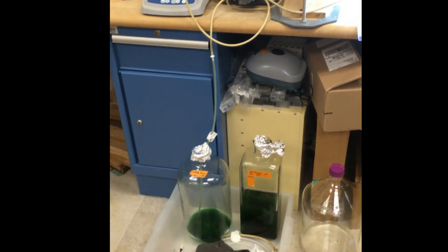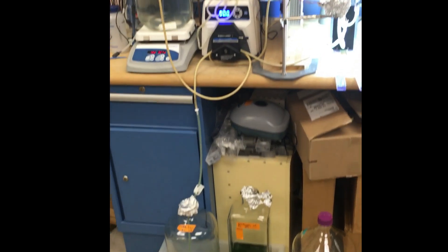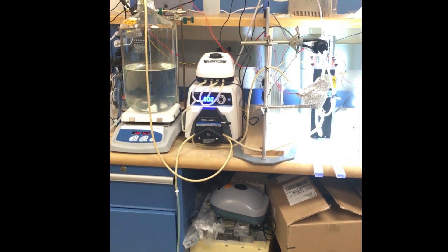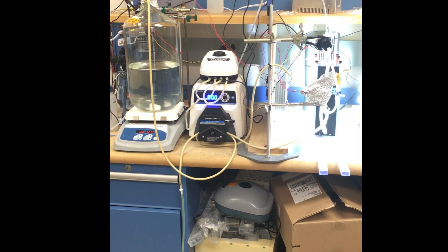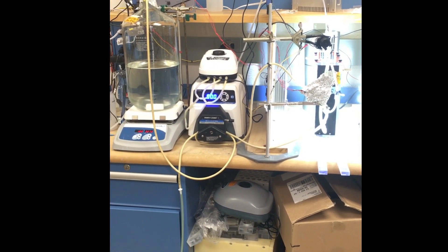In this system, I also have another setup for the LED light. LED light is very efficient compared to fluorescent bulb, which is what we have been used in the lab.